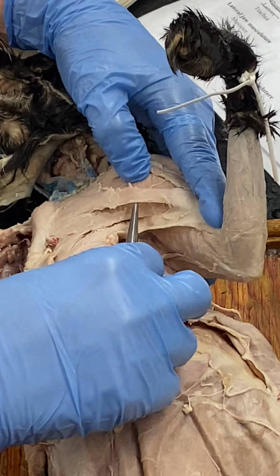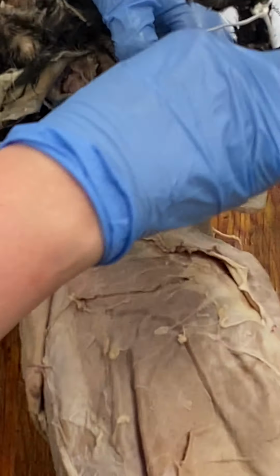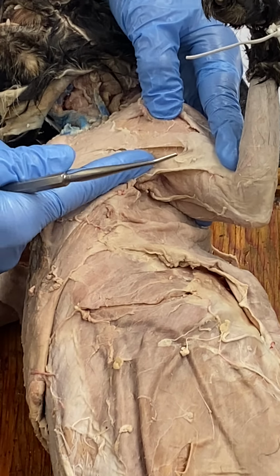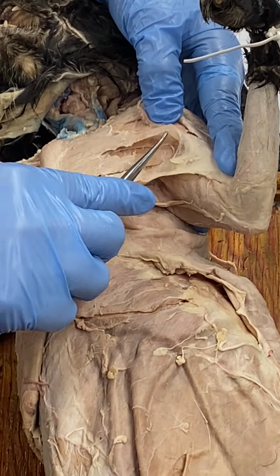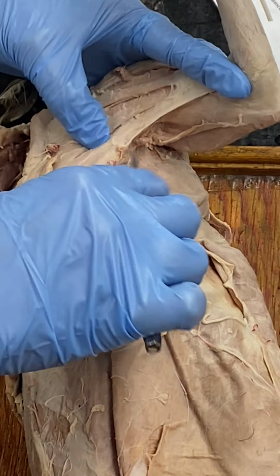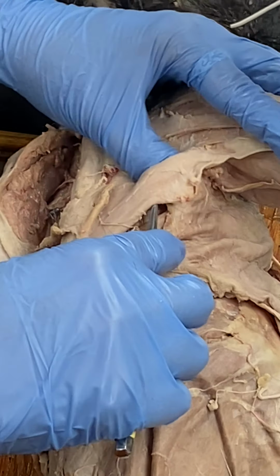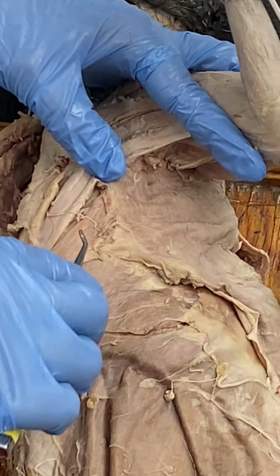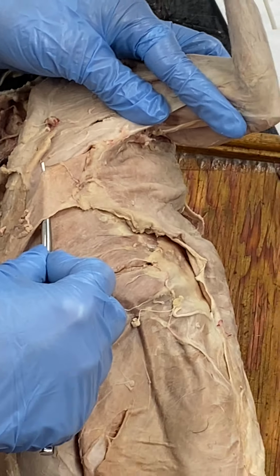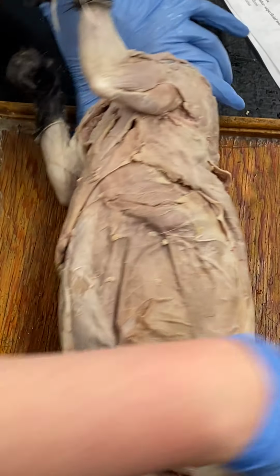Pectoralis major sits underneath. So there's one border of the major. There's the other border of the major. So from there to there is pec major, not including that, of course. Pec minor is caudal to pec major, strap-like. And then xiphihumeralis, caudal again, strap-like. Okay. Deep chest and shoulder.